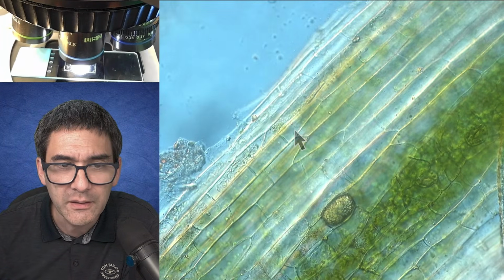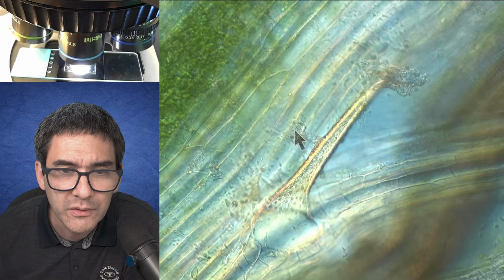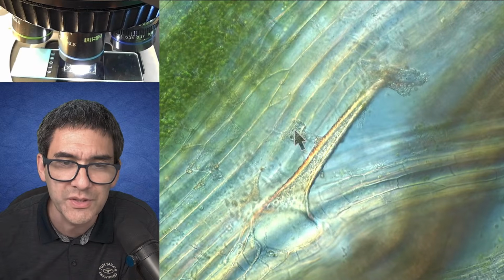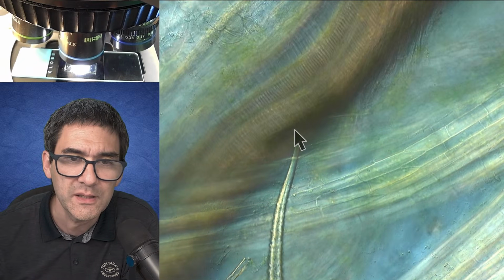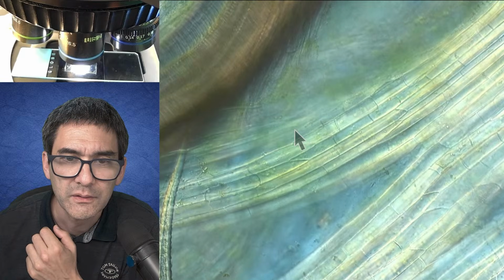So staining might, yeah, exactly. Look also over here. A couple of years ago, I did make a video, and I was quite lucky because I actually was able to see how there was a little droplet of liquid coming out of some of those spikes. But the thing that fascinates me is how extremely thin or pointed they are, right?